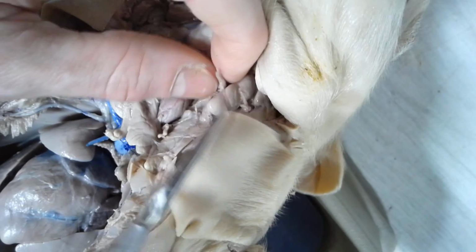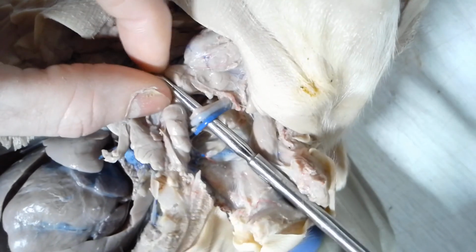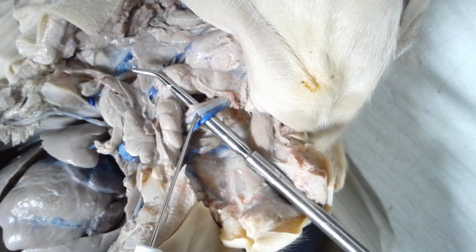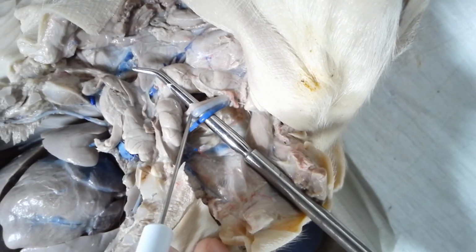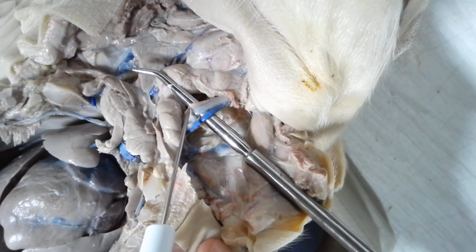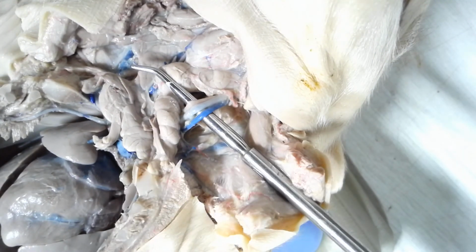So if I focus on pulling up the blood vessels on the other side here, I'll pull these up as well for you. Alright, so blue, jugular. This clear one's carotid. Now this also brought up a third structure right here. This very thin string that you see running right alongside the carotid, this is the vagus nerve. Okay, so you got those 2 blood vessels, jugular, carotid, and the vagus nerve.